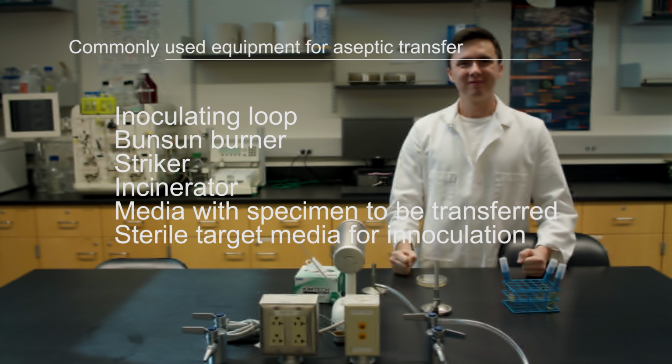Put on lab coat and clean area with disinfectant provided by your lab instructor. Start incinerator to allow it time to heat. Label the target media you are inoculating with basic information such as your name, date, name of the organism, lab table, and lab time. When incinerator is red hot in color, insert the inoculating loop for about 7 seconds until the loop turns bright orange.